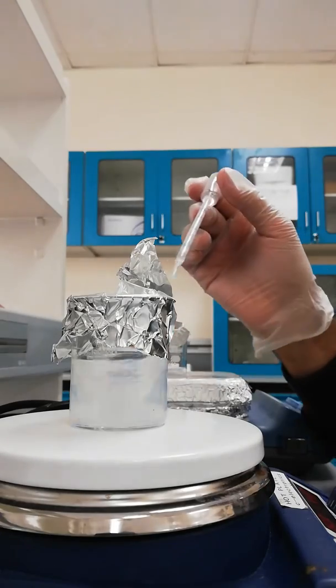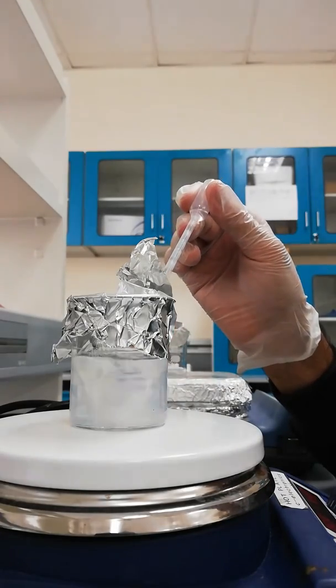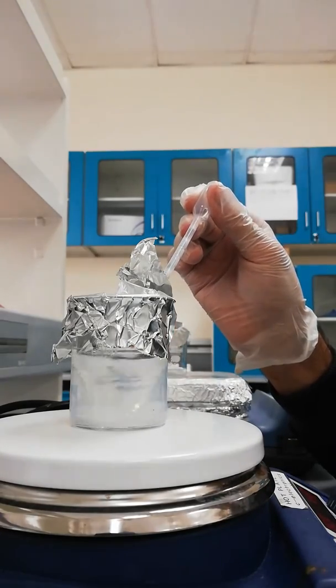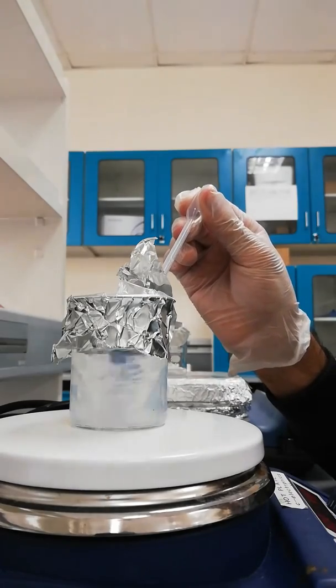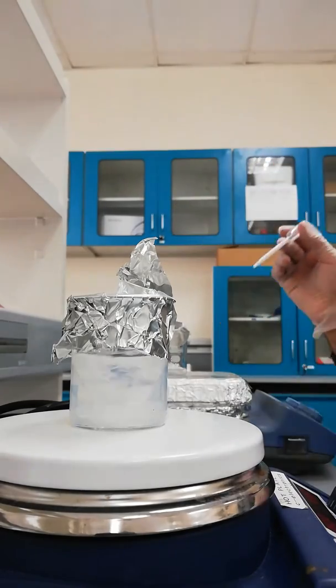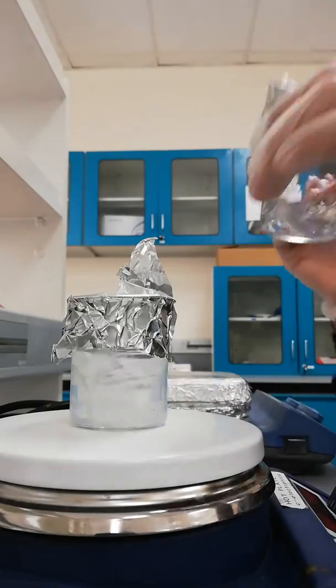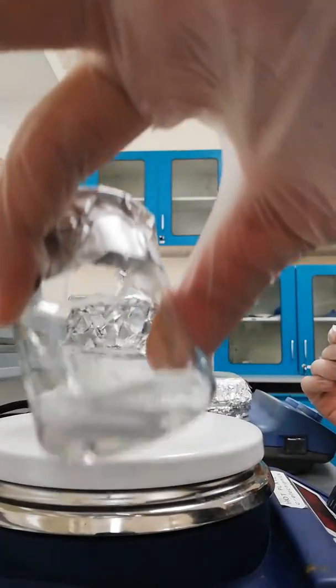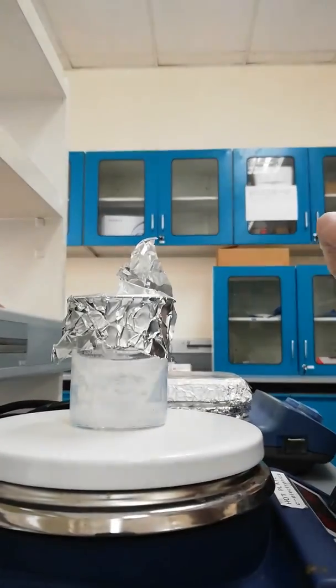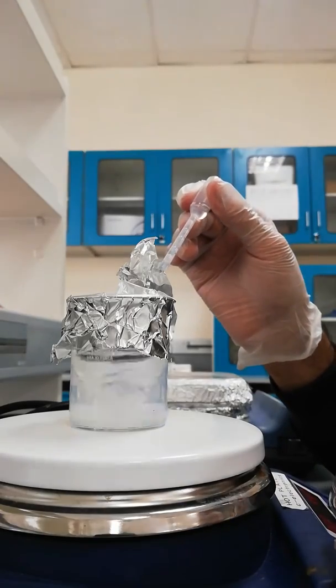It is still a white precipitate, kind of whitish precipitate, but I expect when I finish all the remaining solution of sodium hydroxide its whitishness should get disappeared.